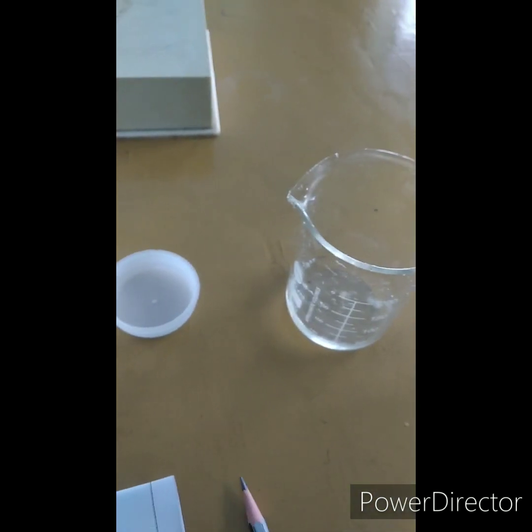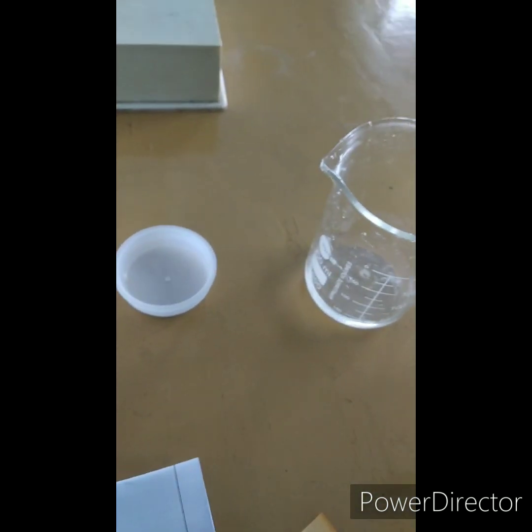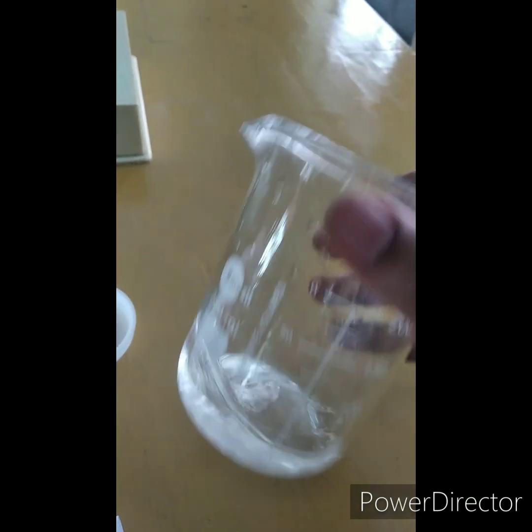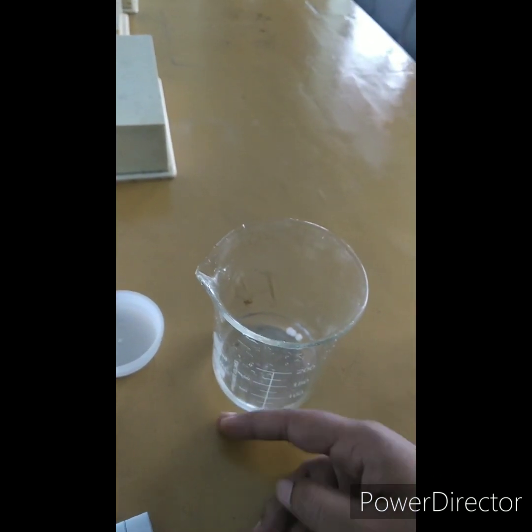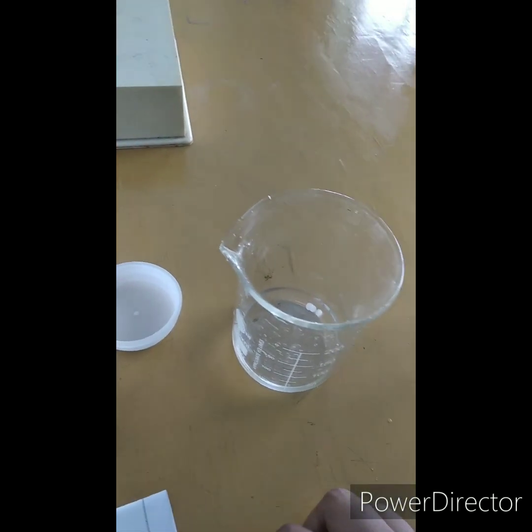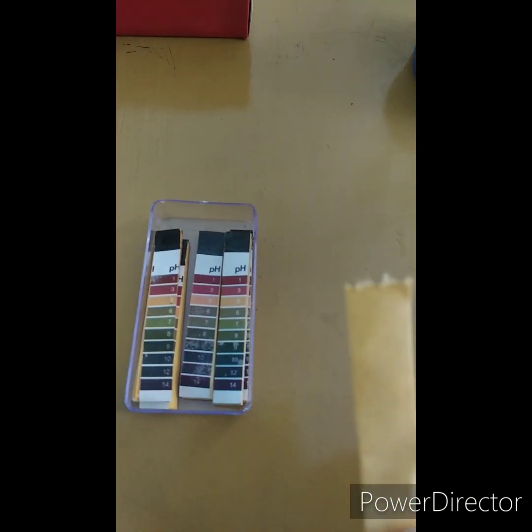As I can see, there is warmth — earlier it was cold to touch, but now it is warm. This is an exothermic reaction. When sodium hydroxide gets dissolved in water, it creates warmth. You can touch it and feel the warmth. This is an example of an exothermic reaction.